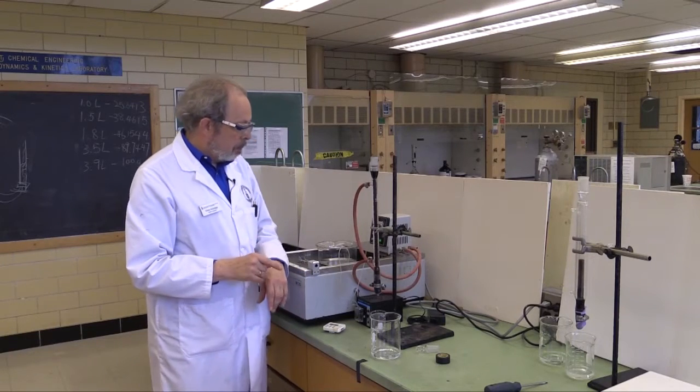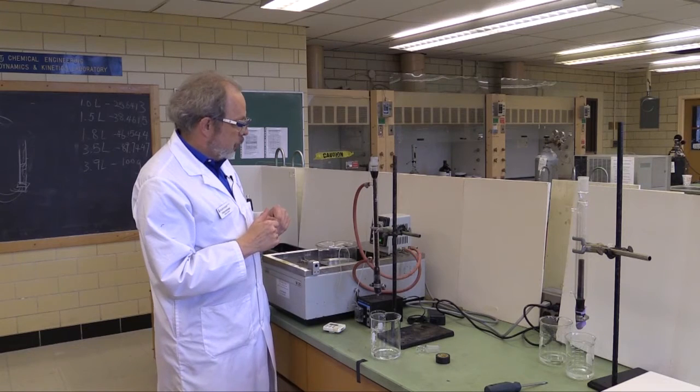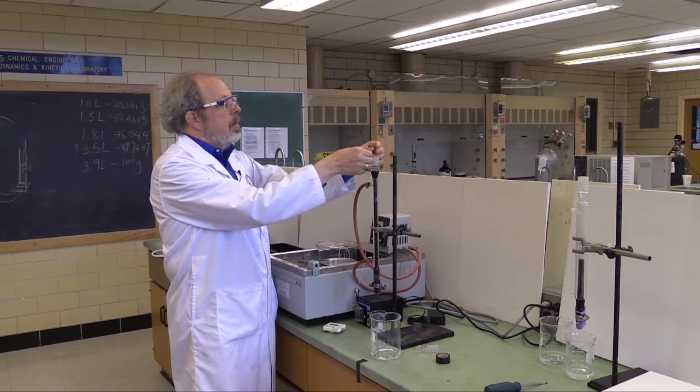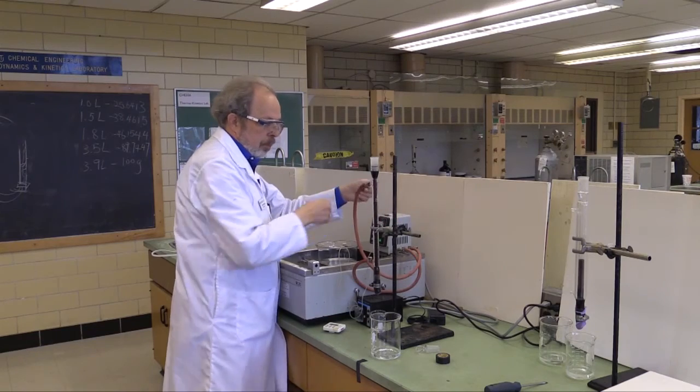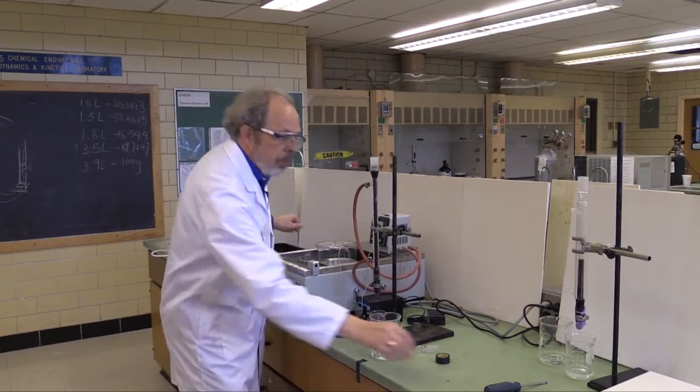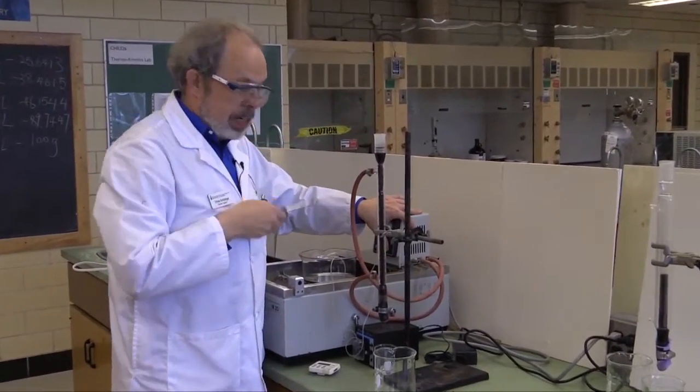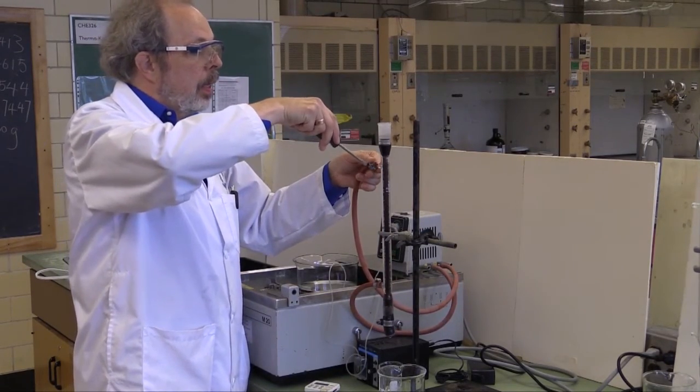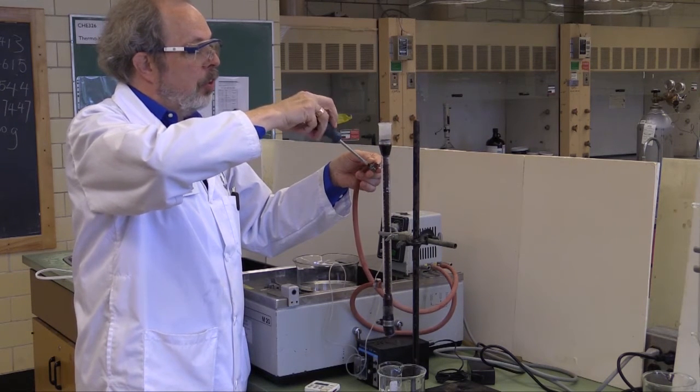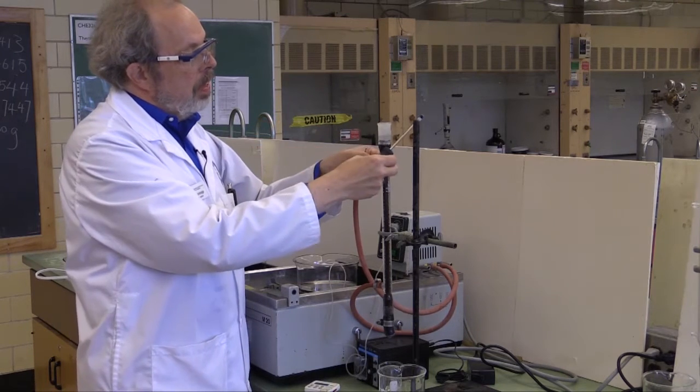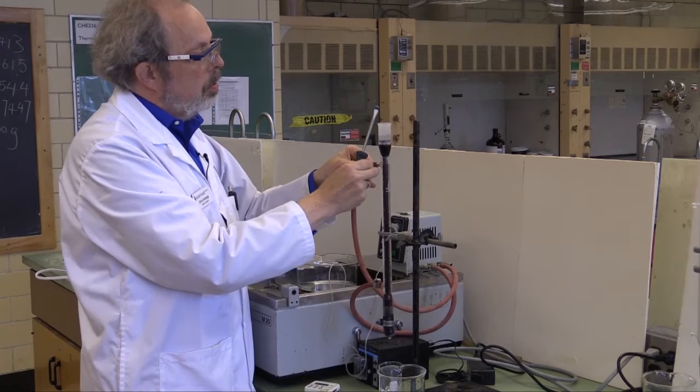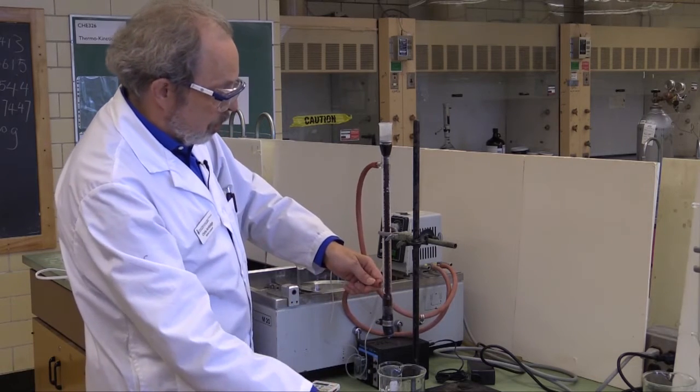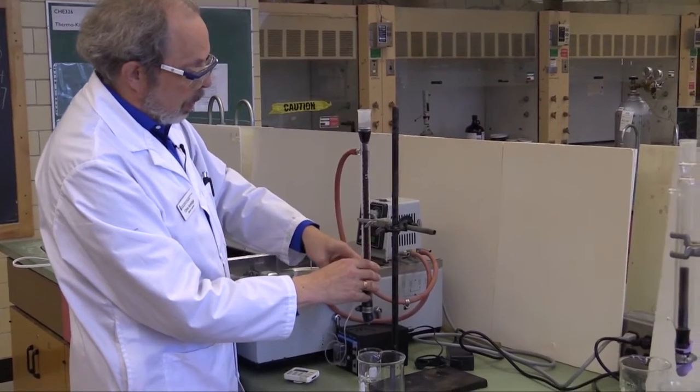Let's talk a bit about changing over from one reactor to the next. First thing to do is turn off the peristaltic pump and remove that tube. We'll also need to turn the pump off first. If you don't do that when you open this, there will be water spraying everywhere, which will be very amusing to the other people, but not very amusing for you. So, just leave the hose clamps actually on the hose, and that will help. Once we've got these out of the way, then there will be some water flow out of the condenser jacket when I open the tubes.